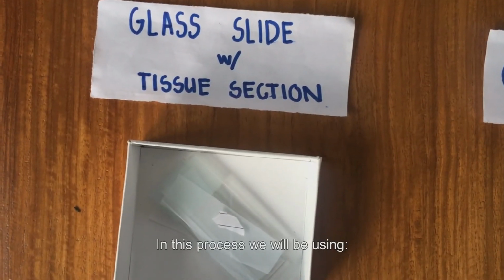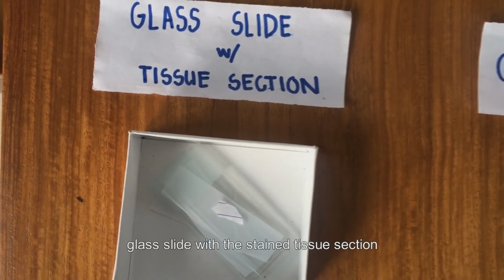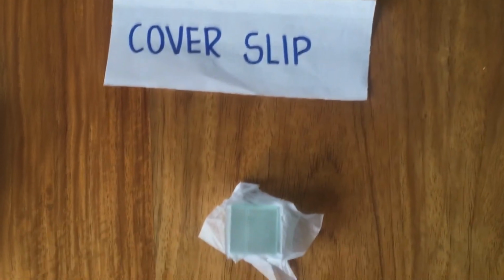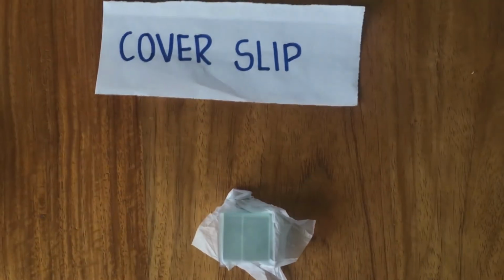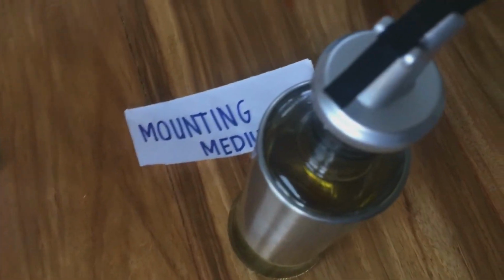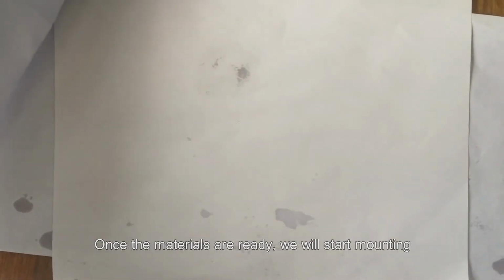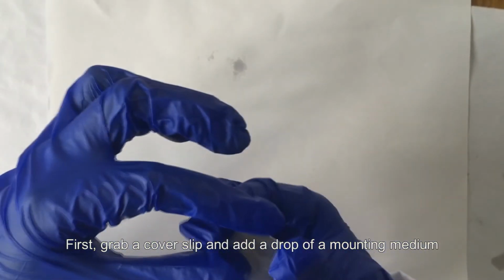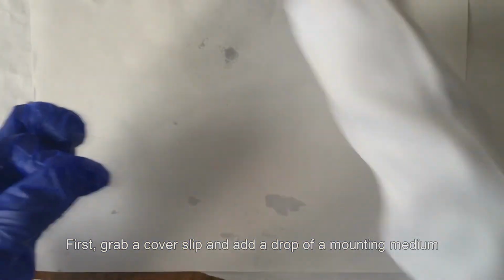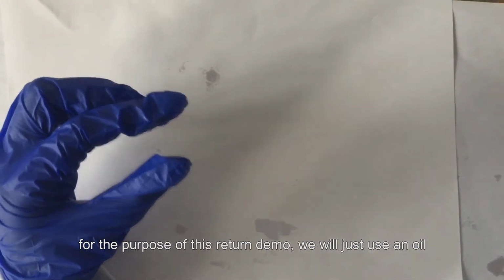In this process, we will be using glass slide with the stained tissue section, cover slip, and of course, the mounting medium. Once the materials are ready, we will start mounting. First, grab a cover slip and add a drop of a mounting medium. For the purpose of this demo, we will just use an oil.